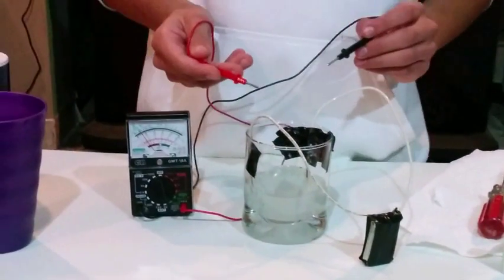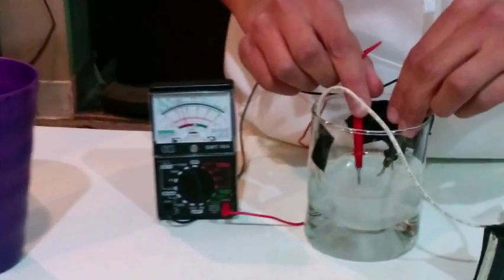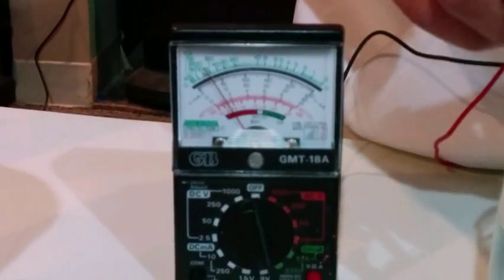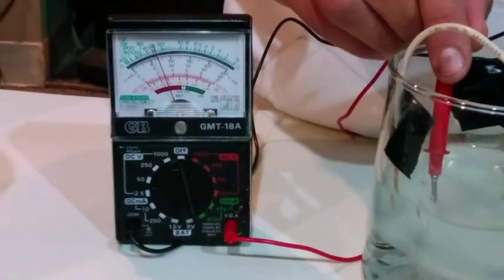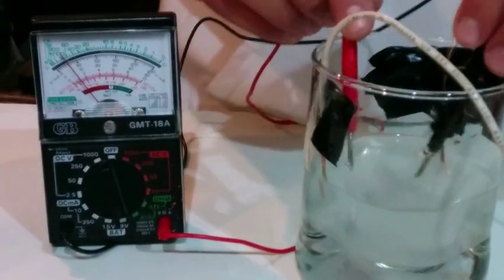After letting the salt dissolve on its own for about a minute or two, we'll try again. Now you can see that as I dip the two prongs into the water, there's a connection—a weak one at first, and as the salt continues to dissolve, the conductivity will increase.